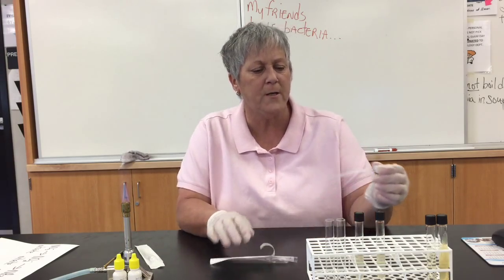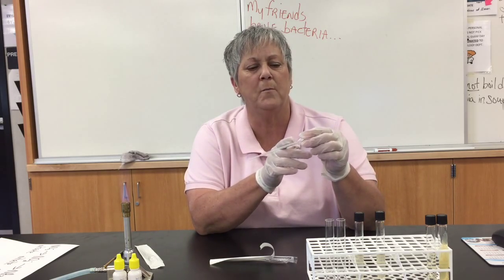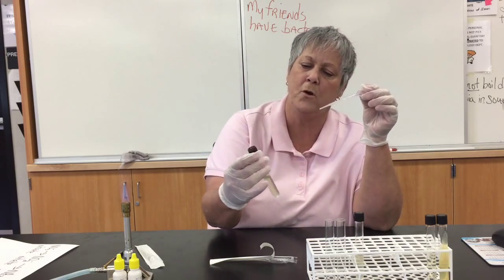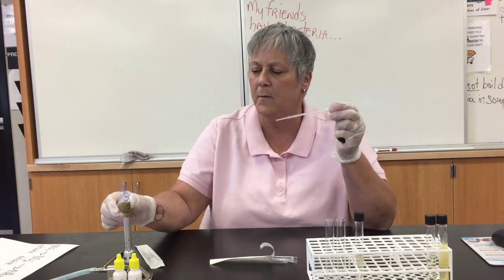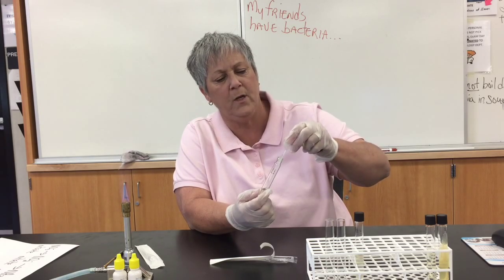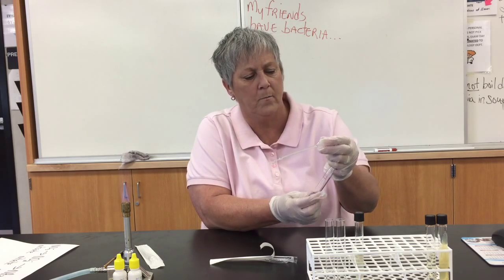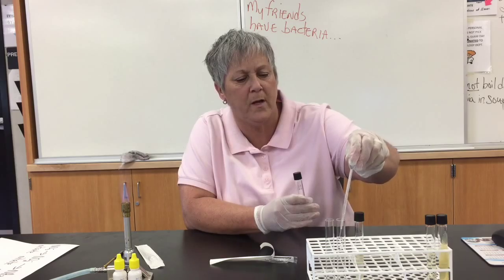I'm going to use a sterile pipette, and I just want to remind you that I need one ml of organism — this little mark up near the bulb is the one ml mark. So I'm starting with my E. coli, and I'm going to go ahead and get one ml of E. coli broth out and transfer that to one of my clean tubes.